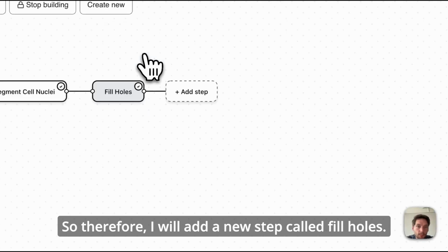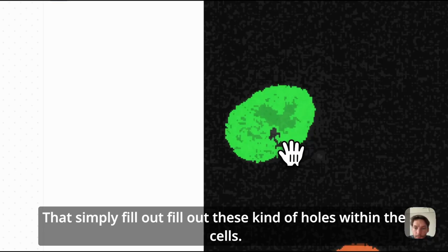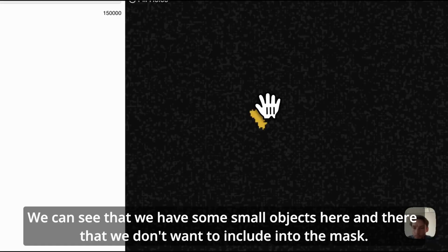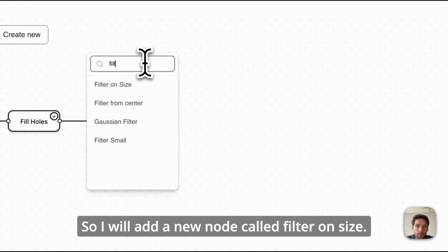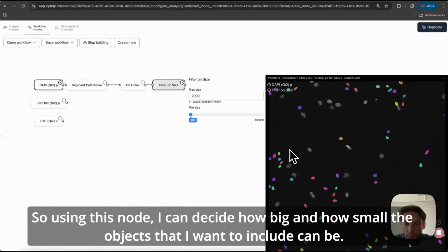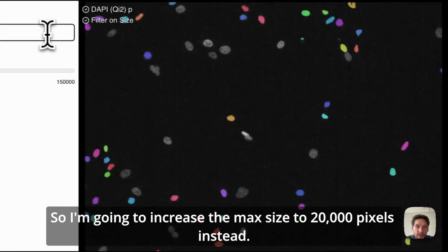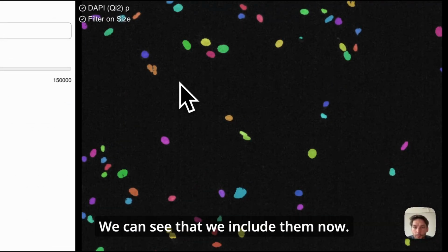called fill holes that simply fills out these holes within the cells. We can see that we have some small objects here and there that we don't want to include into the mask. So I will add a new node called filter on size. Using this node, I can decide how big and how small the objects that I want to include can be. We can see that we miss a lot of the cell nuclei that we want to include, so I'm going to increase the max size to 20,000 pixels instead, and we can see that we include them now.